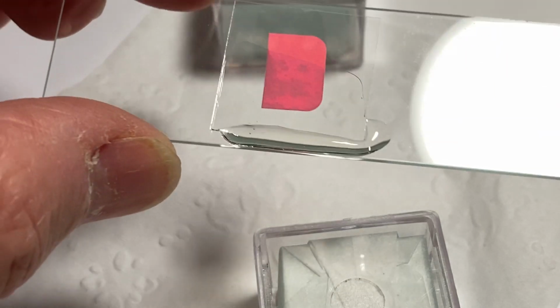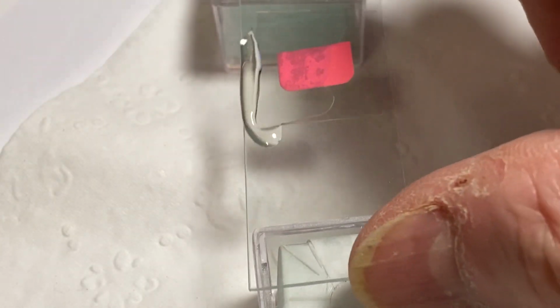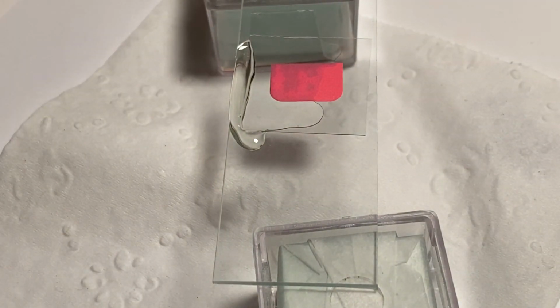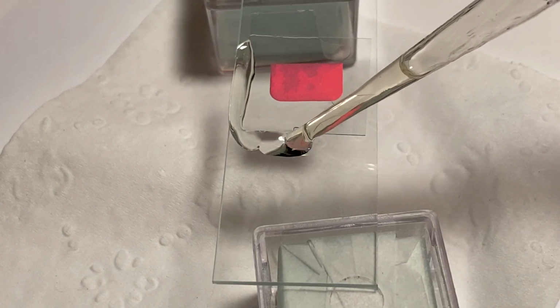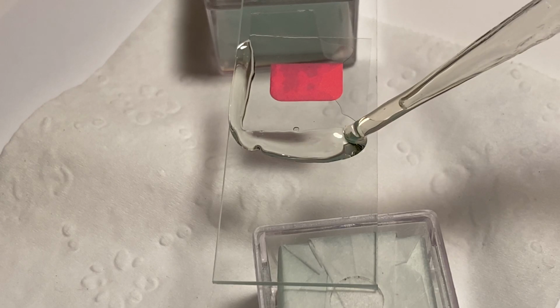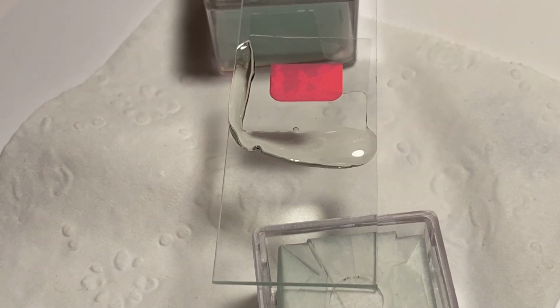I think we need a little bit more. Yeah, we need a little bit more. It's going to take a while. Well, this is a flat piece of paper, and it should flow quite easily. This one isn't. But we don't want to put too much on there, but we'll add a little bit more. There it goes. Okay, good. You can't see that because of the lighting. I have a big problem with lighting.